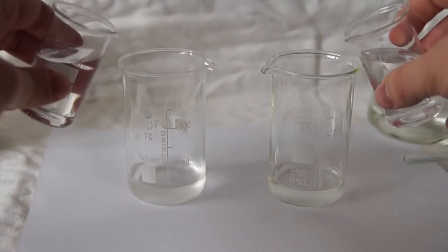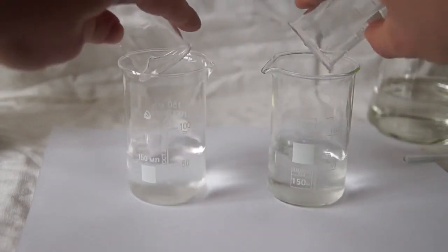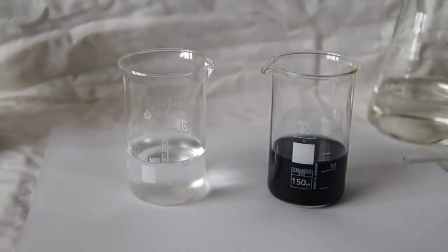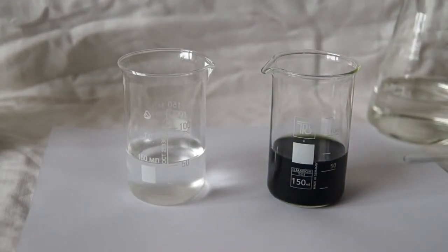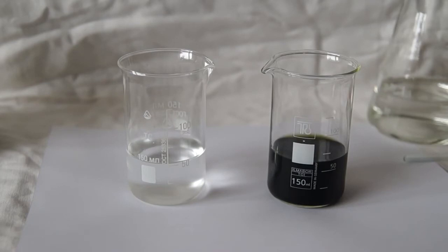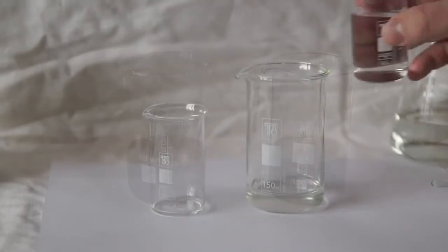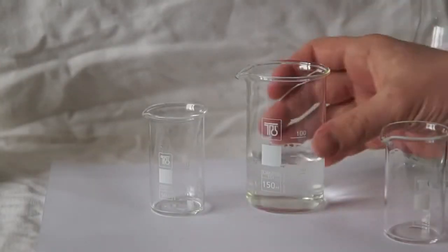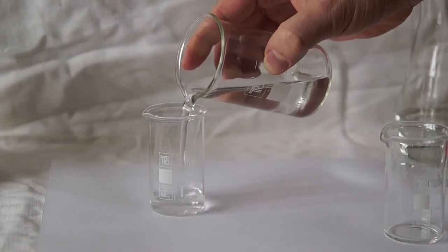One, two, three — and mix the solutions. The first solution reacts rapidly, but the second one takes a bit longer. This reaction is quite beautiful and spectacular. You can play with it for a long time.